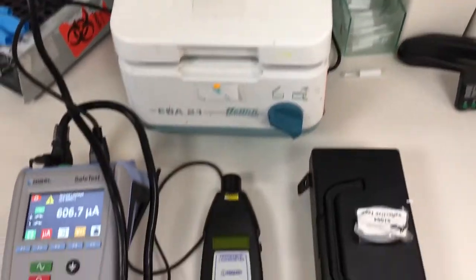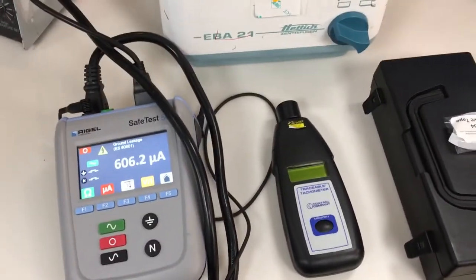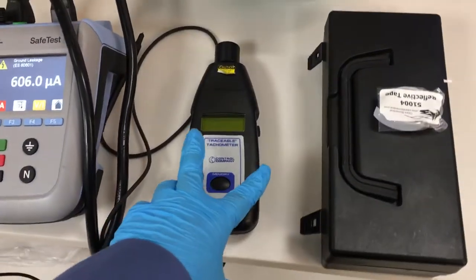Hi everybody, in this video I show you how to check the centrifuge speed with the tachometer.